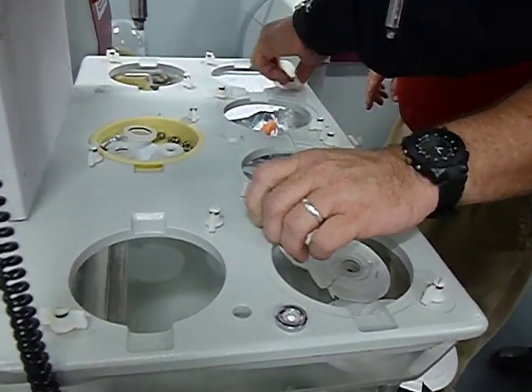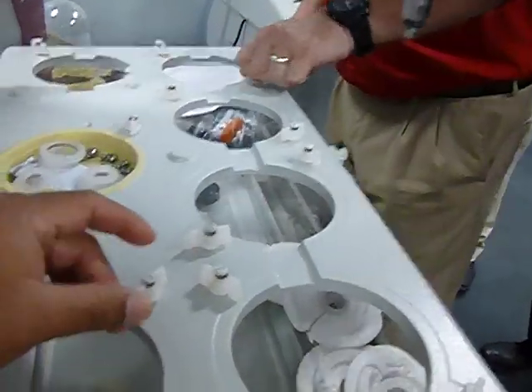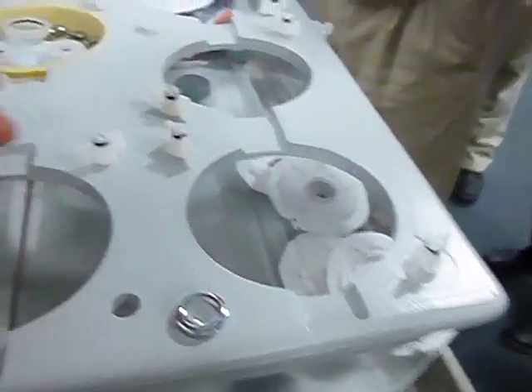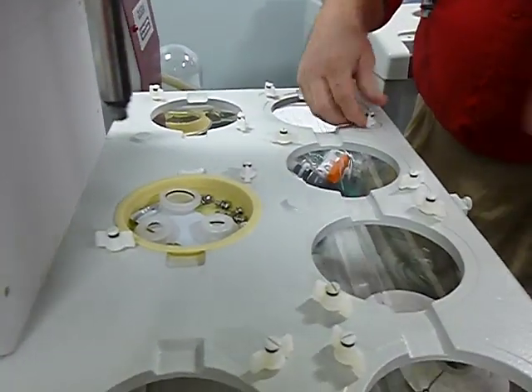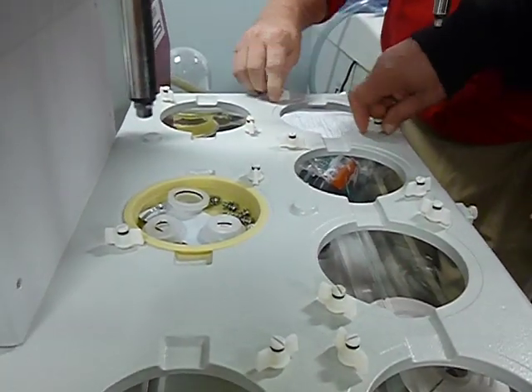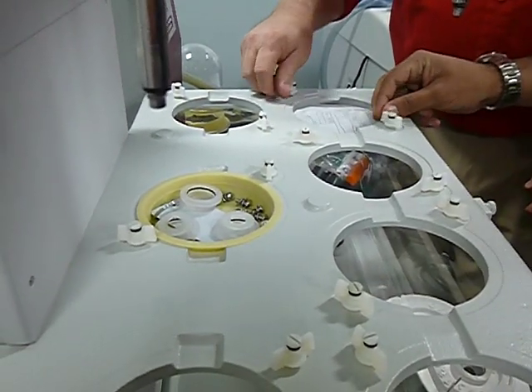You don't want them. It's not working. Yeah, maybe. Oh, it's too tight. Yeah, but if you unscrew it, then it will screw out. Well, sometimes they do. See? Now it's not. Really? Yeah. Maybe it settles in 1 hour. See? What happens is, I'll show you what happens here.